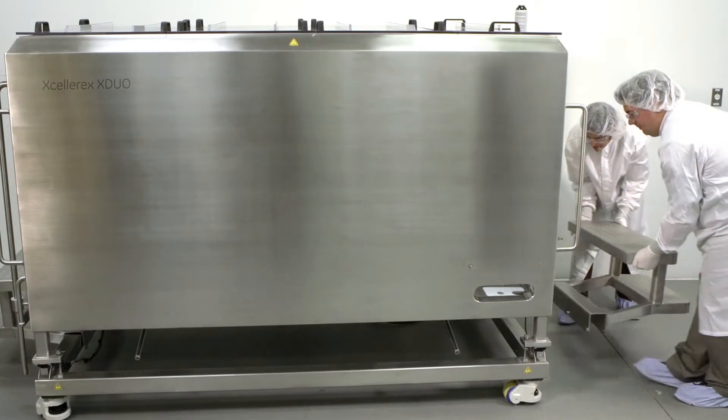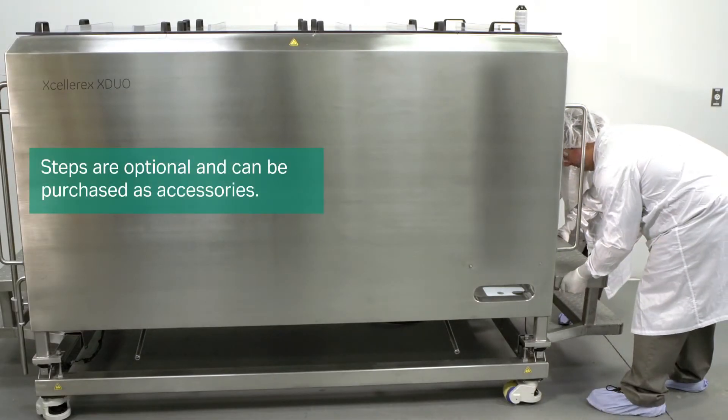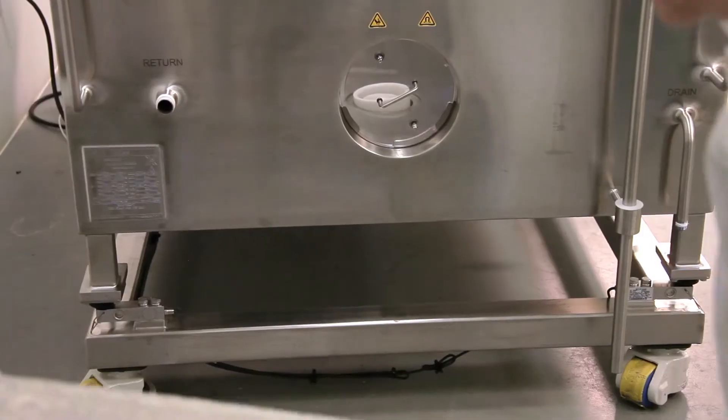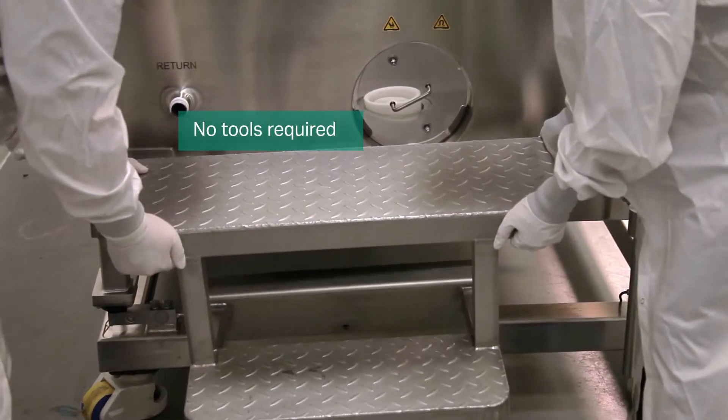Steps can be used to provide access to the top and inside of the mixer vessel. Attach the steps to the mixer frame of the vessel.